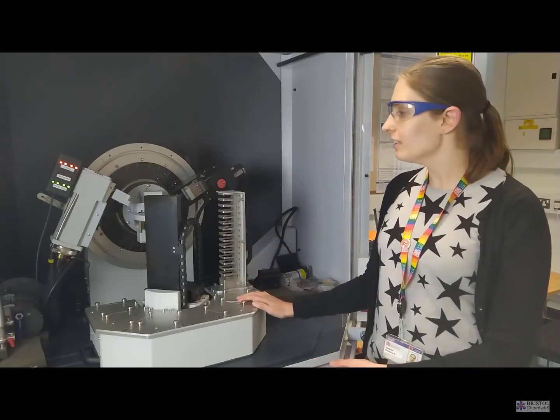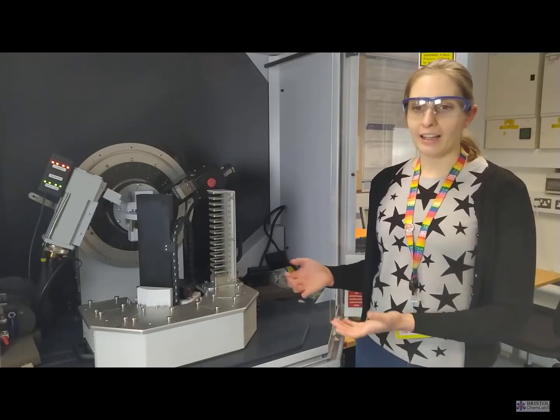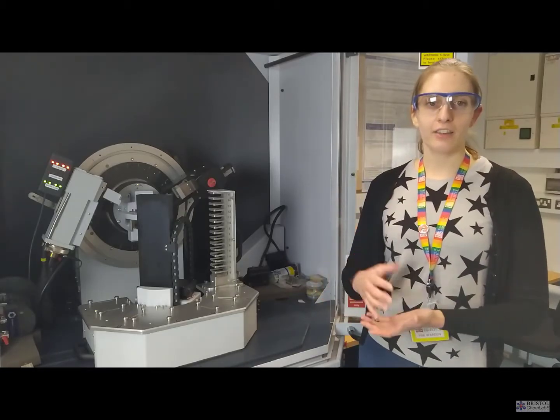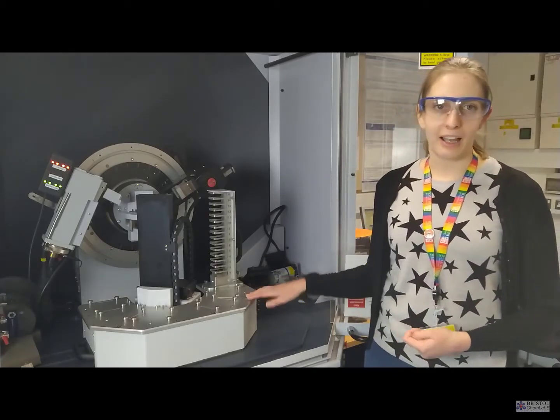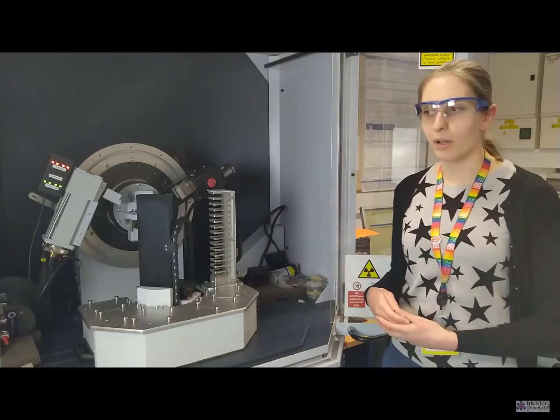So, as mentioned, this instrument allows us to analyse thin films, potentially, say, a film that you've made as part of a solar fuel device, and you want to check that you've made the structure that you were intending to make, because that's the one that's going to have the correct properties for your application. So this is a quick non-destructive technique that allows you to check that structure against known structures for those materials and confirm if you've made the one that you wanted to make.